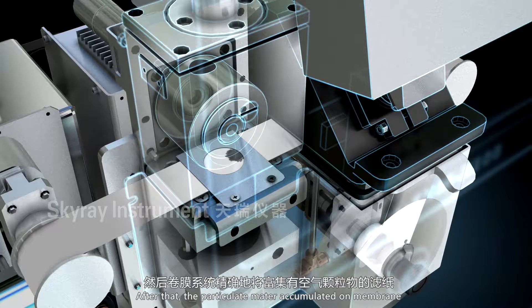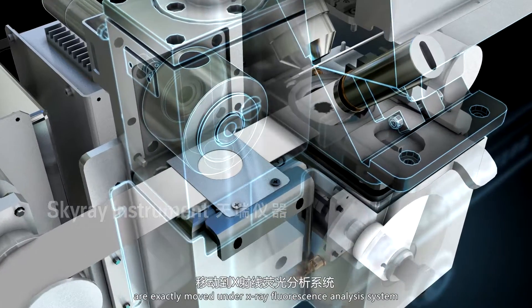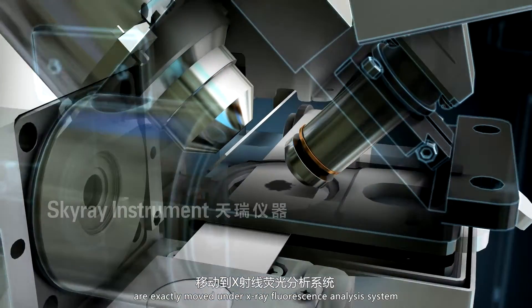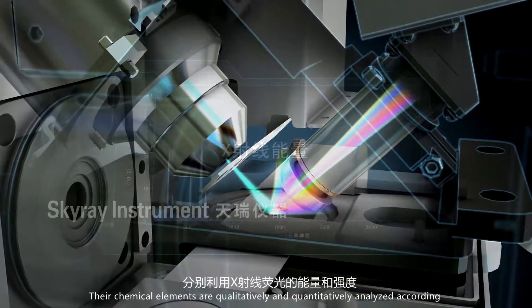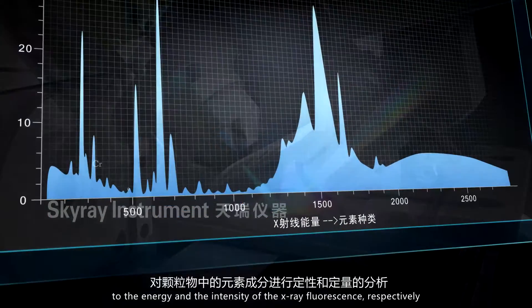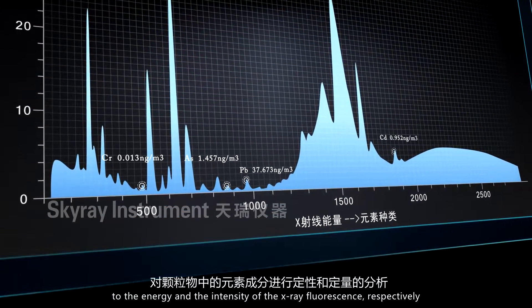After that, the particulate matter accumulated on membranes are precisely moved under the X-ray fluorescence analysis system. Their chemical elements are qualitatively and quantitatively analyzed according to the energy and the intensity of the X-ray fluorescence, respectively.